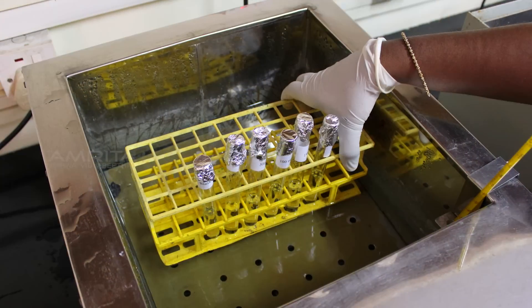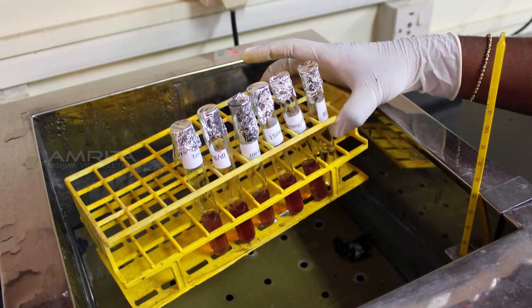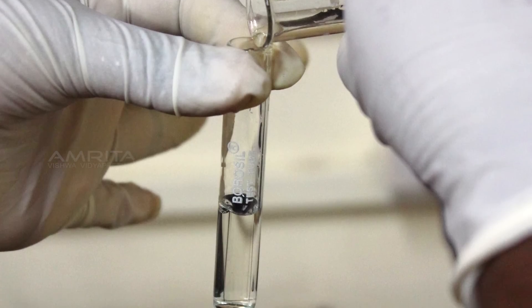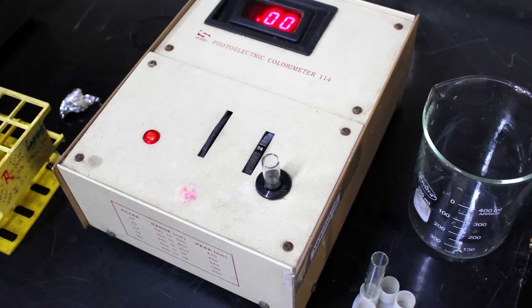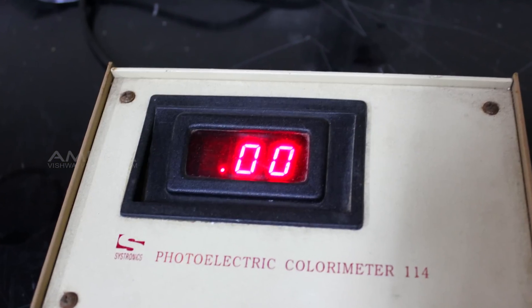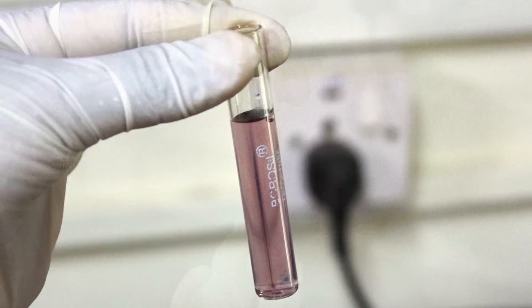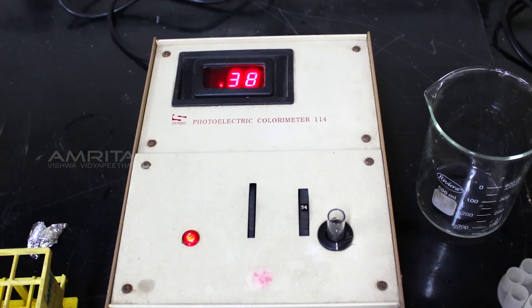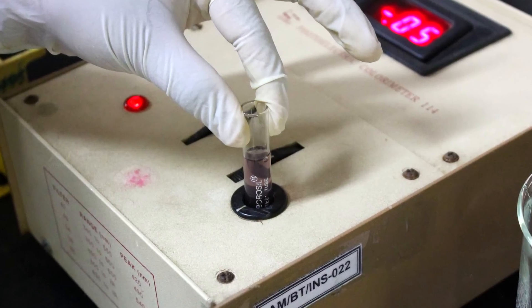Cover the test tubes with aluminium foil and place them in the water bath at 37 degrees Celsius for 1 hour. After 1 hour, take out the test tubes from the water bath and transfer the blank solution to the cuvette. Insert the cuvette into the slot of the colorimeter and set the value to 0. Next, transfer the 50 mg per deciliter solution from the first test tube to the cuvette. Insert the cuvette into the slot of the colorimeter and note the reading. After getting the reading, remove the cuvette from the slot.